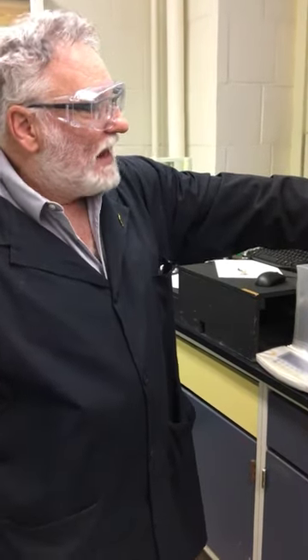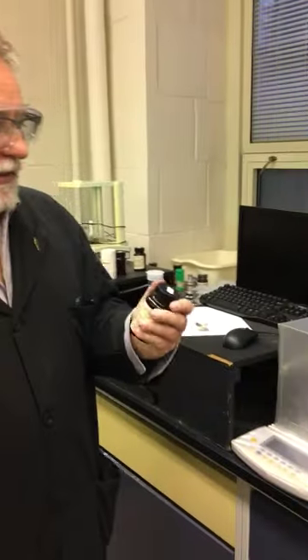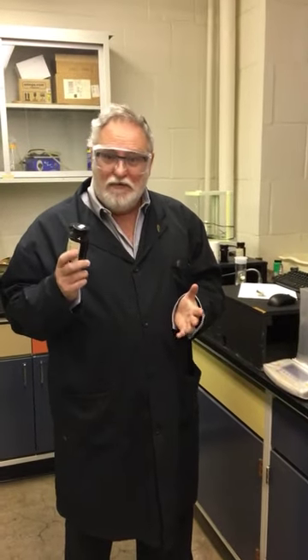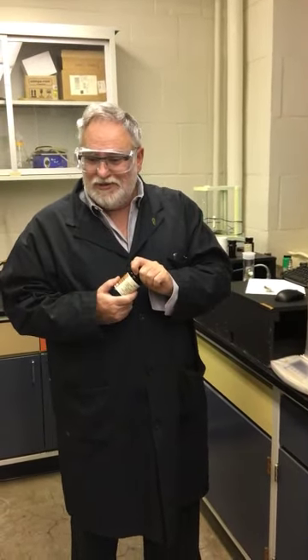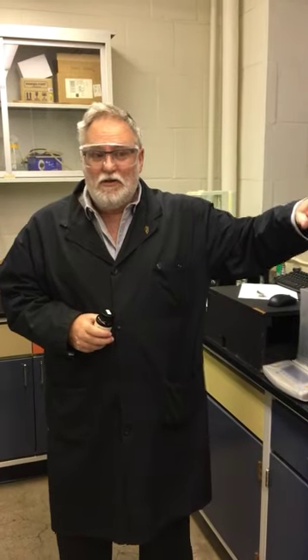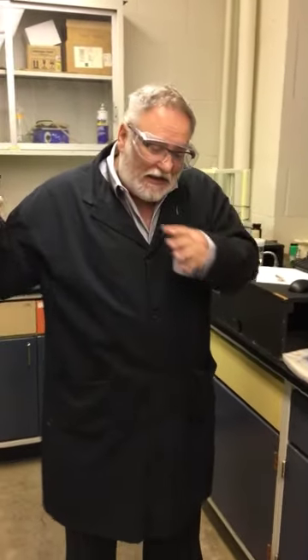So, how do we calibrate the instrument? We purchase standards. A calibration might be 5 to 10 samples, probably done in at least triplicate, maybe even more. And so you're starting to look at 30 analyses, maybe 40 analyses. So we don't do the calibration very often. We have a calibration for high rank coals, we have a calibration for low rank coals, for biomass. We have some calibrations that will span that rank range, so we can do maybe things added in together.